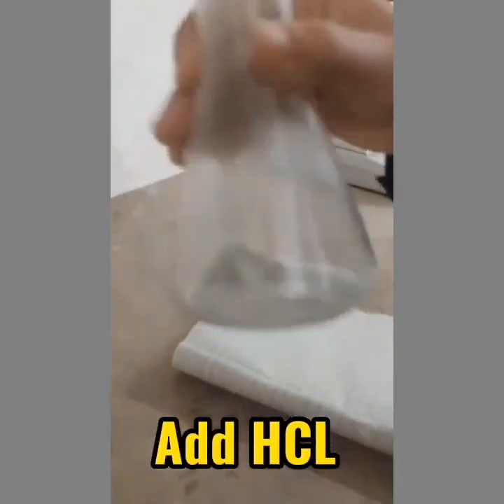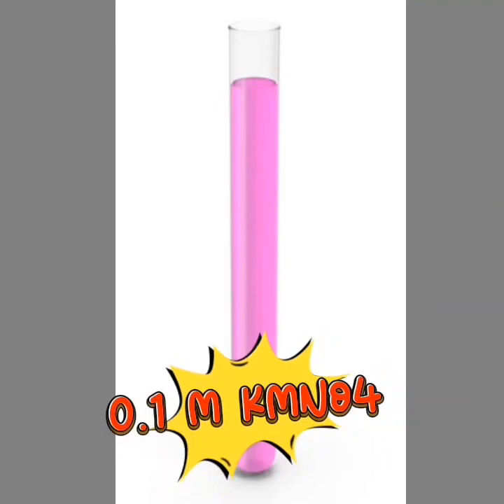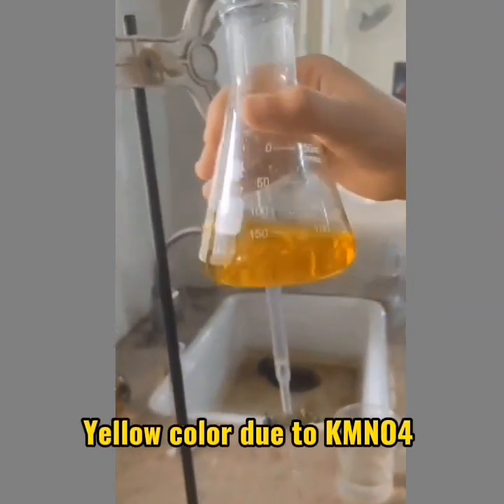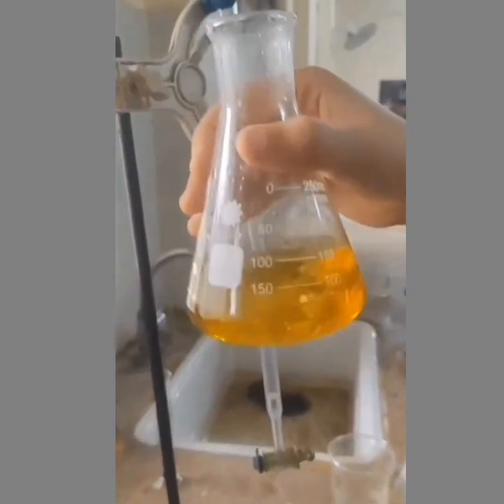Now we add HCl to our steel sample. We add 0.1 molar KMnO4 to the steel sample. So the solution becomes yellow in color due to the addition of KMnO4 to it.